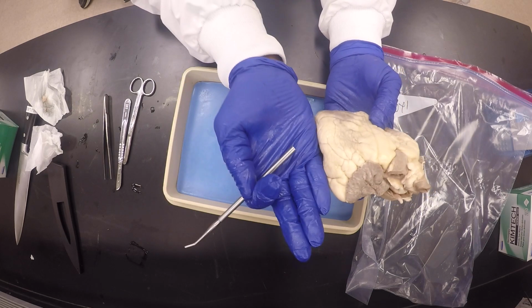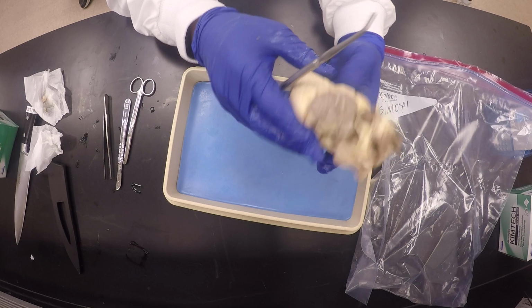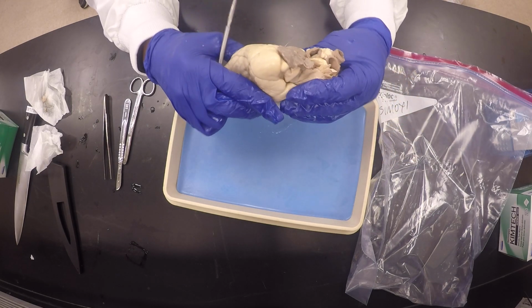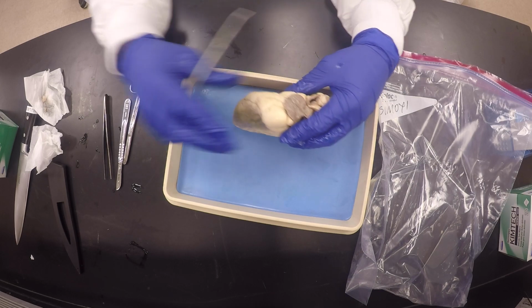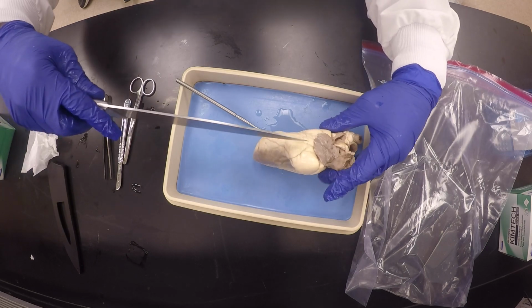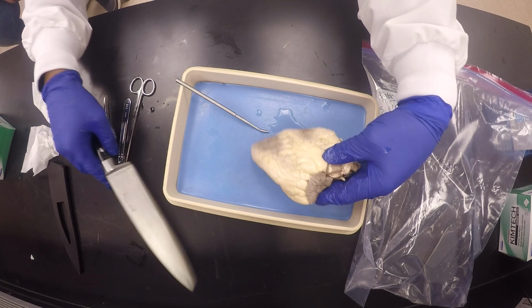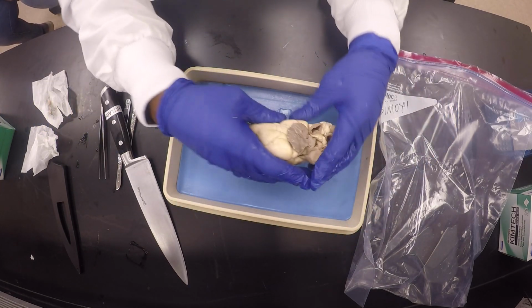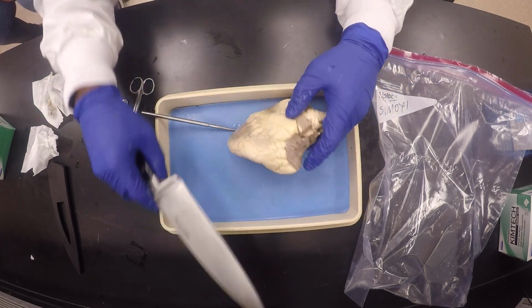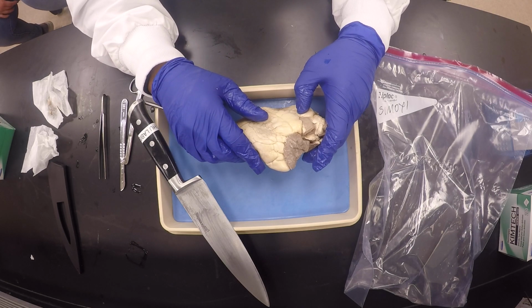So we're going to cut from the left side, and we leave it hanging by the right side here. It has to be nice and central, otherwise it's going to cause problems. So hopefully I'm lucky and I get a good cut. I'm going to cut like this, from the left side going to the right side, to see the internal structures. Okay, let me stop the video so that it's not too long.